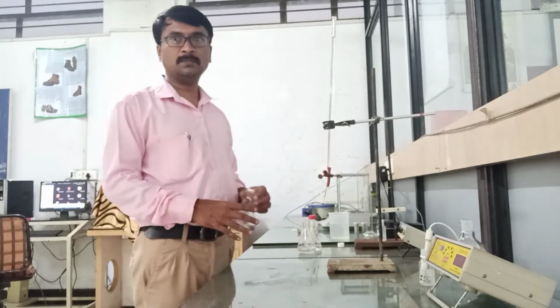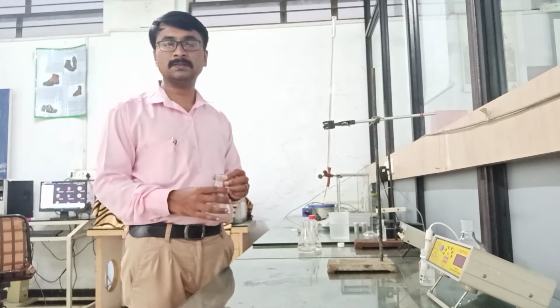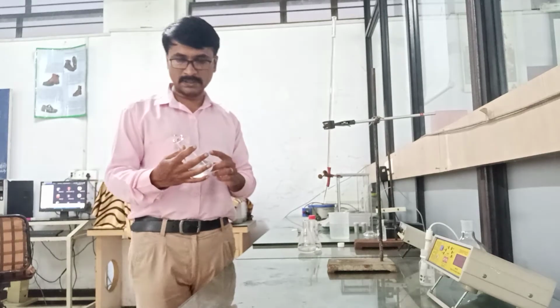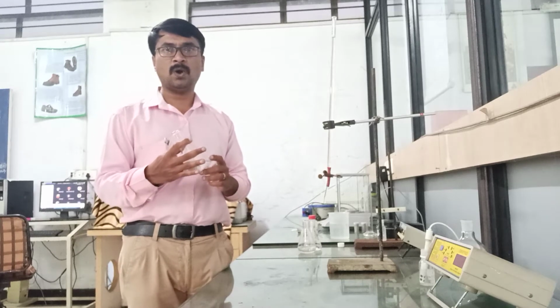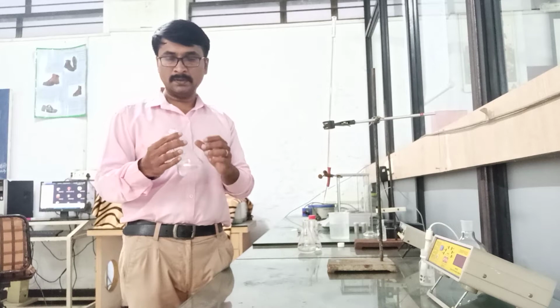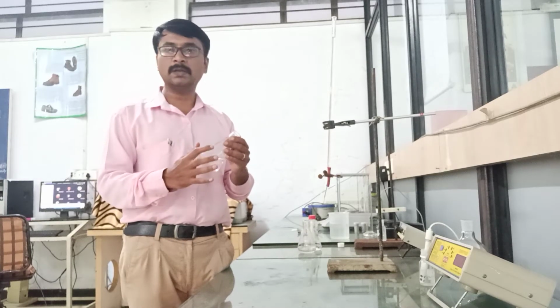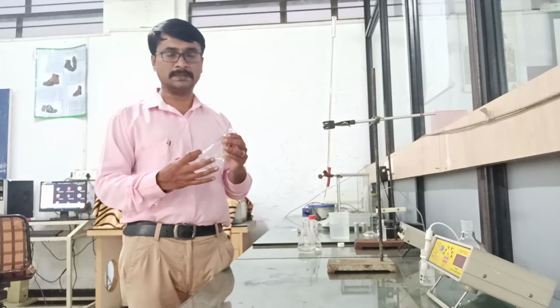Hello, welcome to the experimental session of Technology of Inorganic Chemicals. In this session, we are going to determine the percentage of carbon dioxide content in a water sample. As the carbon dioxide gets dissolved in water, it will increase its acidity.